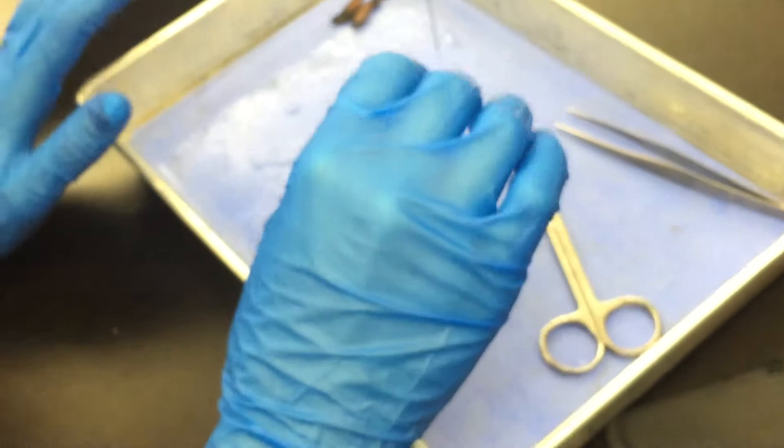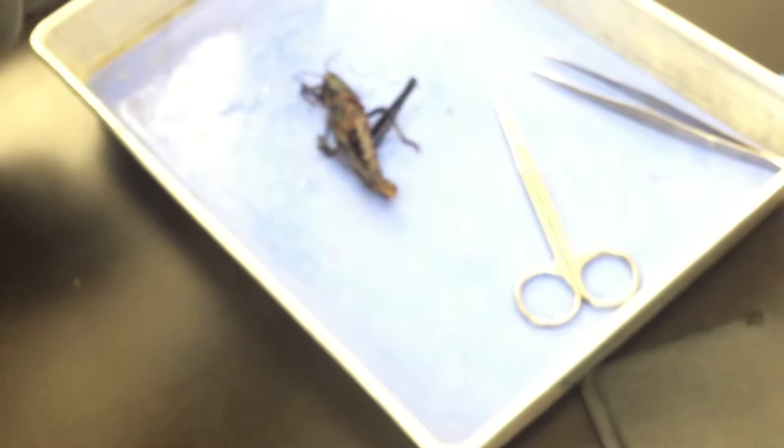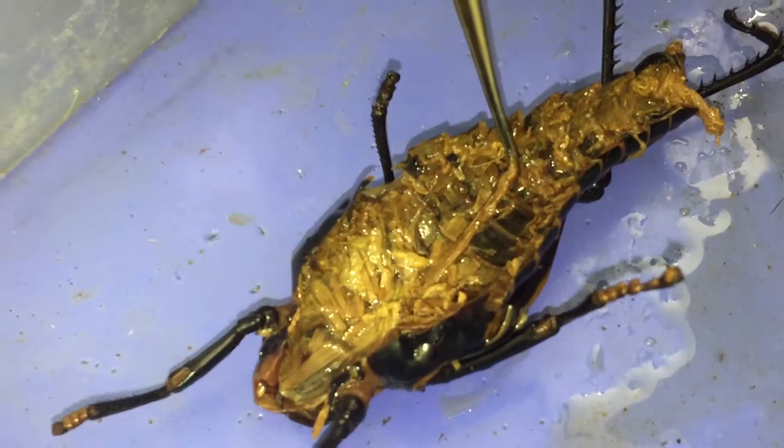Once you try to find the heart, if you have trouble finding it, come over here and look at this one. There we go — it goes all across the dorsal side. These guys are so beating us at chopping things.